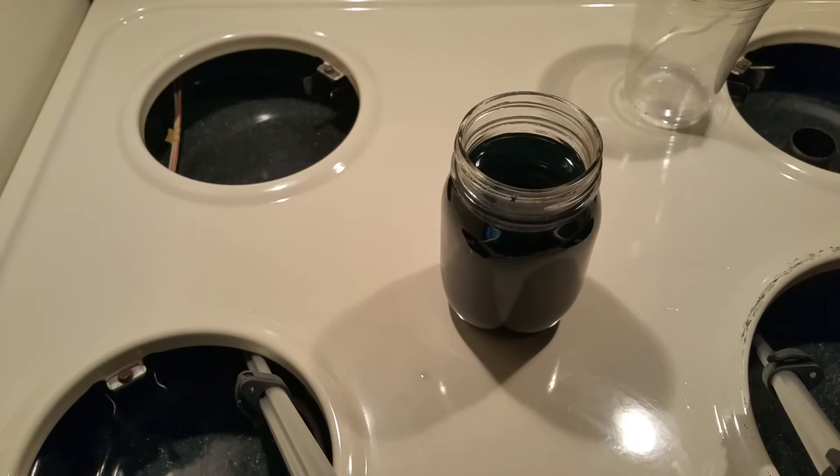It is very important that your seed crystals are without flaws — choose one that is large but also visually beautiful. I let my crystal solution sit for about four days and came back to a large polycrystalline mass in the bottom of my beaker. It had actually started to form onto the beaker itself, so if I were to repeat this experiment I would choose a much larger vessel, or I would pick out my seed crystals and use them rather than letting the entire crystalline mass sit in the container.